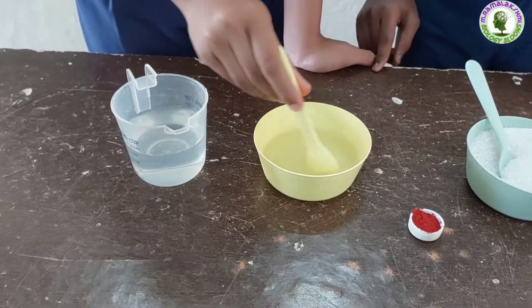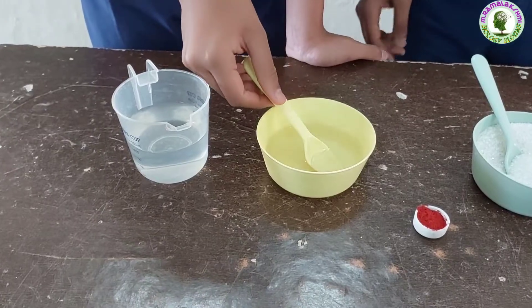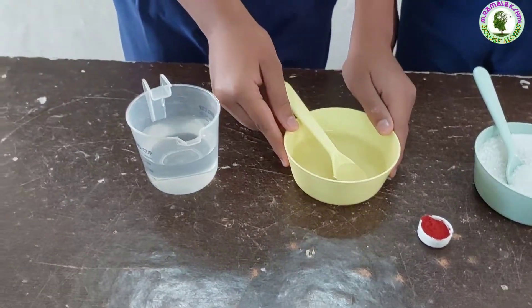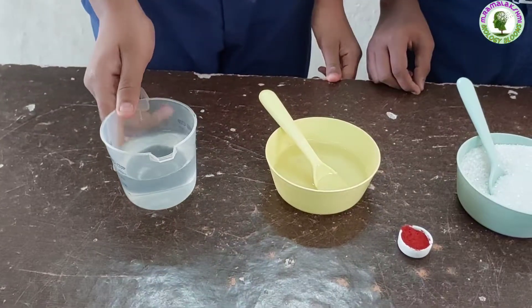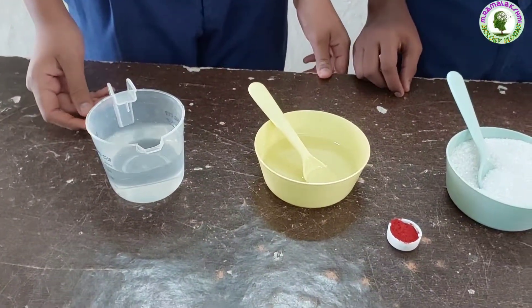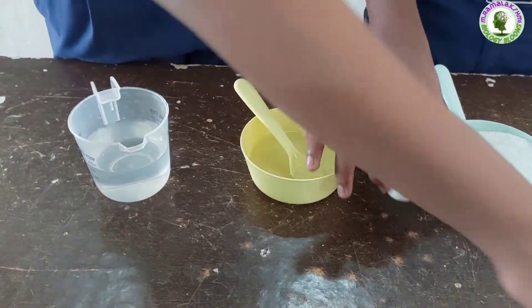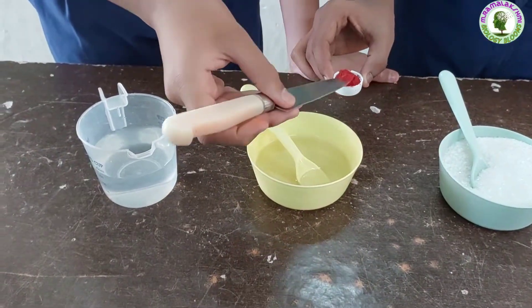Now we have two types of solutions — saturated sugar solution and water. Children, add some food color to the sugar solution to distinguish between the two solutions.